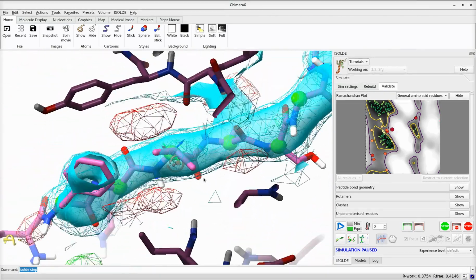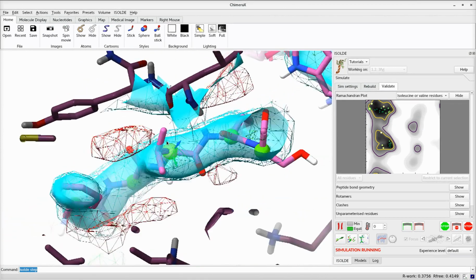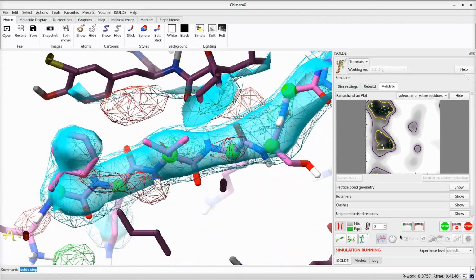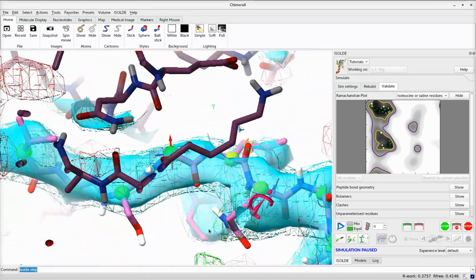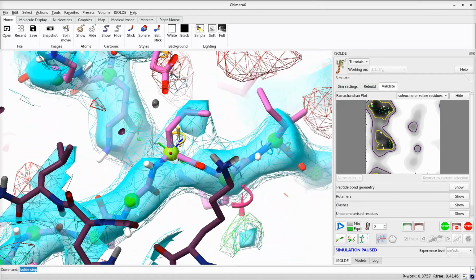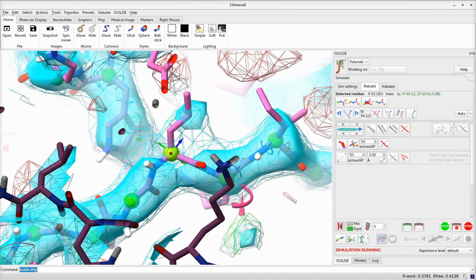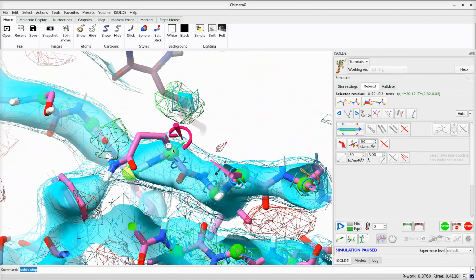Most of these occur in sites where the reference sequence is different from the model, others where the starting model was simply too far from correct for the restraints to take hold, and some where the model conformation is genuinely different from the reference. In these latter cases, it is sensible to selectively release the disagreeing restraints via the use of the ISOLDE release torsions command. However, where the model and reference do agree well, keeping the restraints active generally does lead to an improved result even after the model has settled to the new conformation.